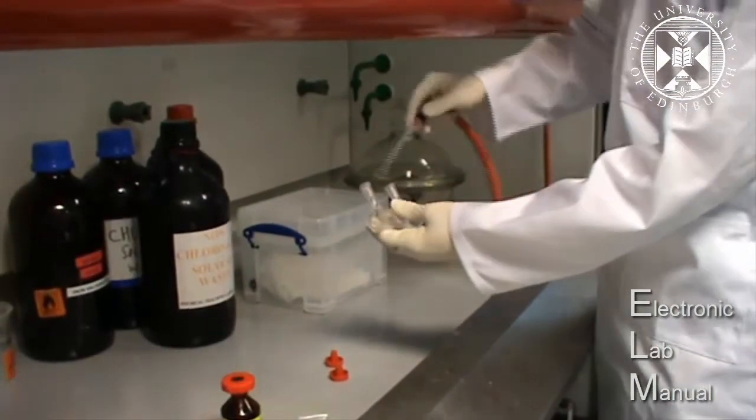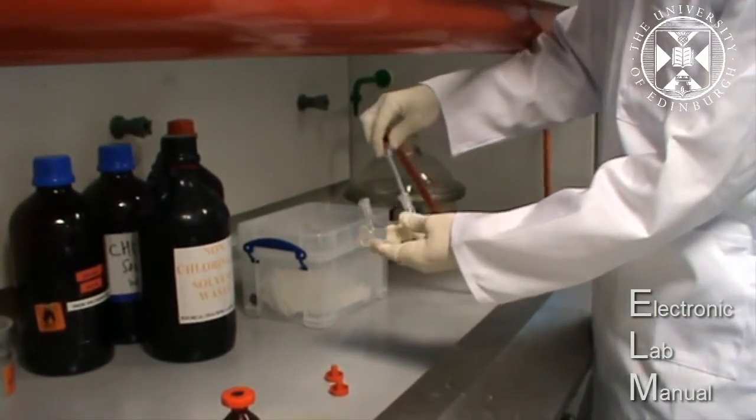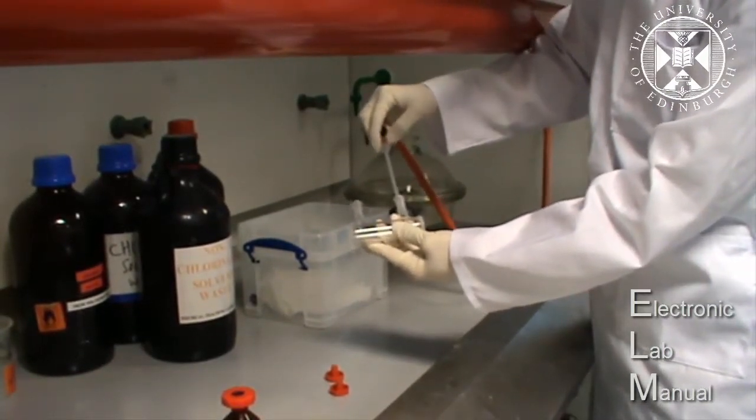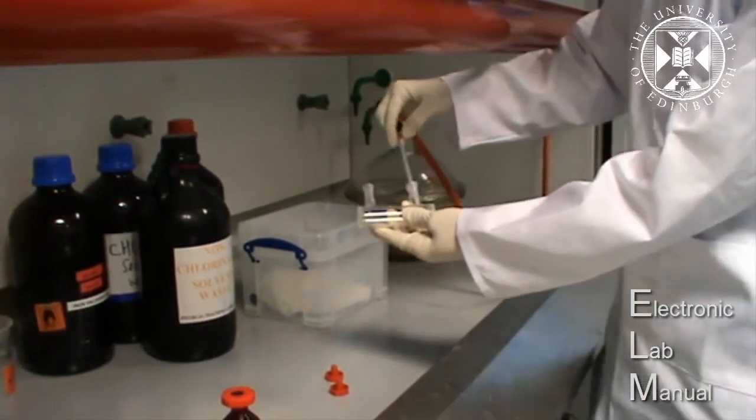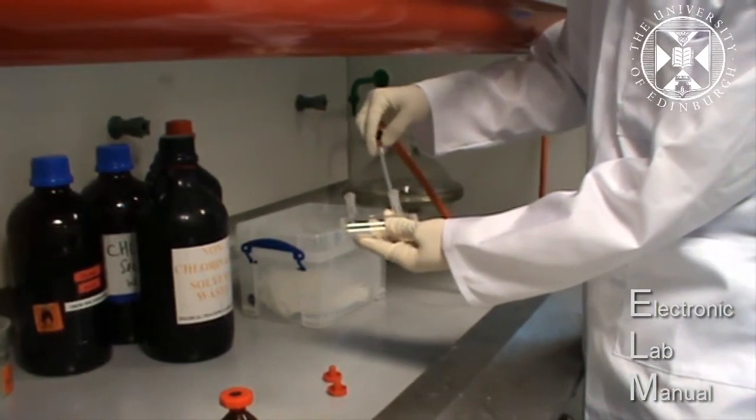And flush it with nitrogen, like so. Probably best to do this for just a couple of minutes to make sure the cell is fully flushed.